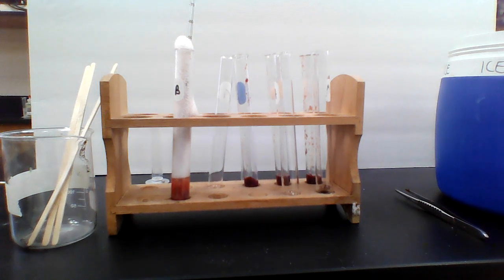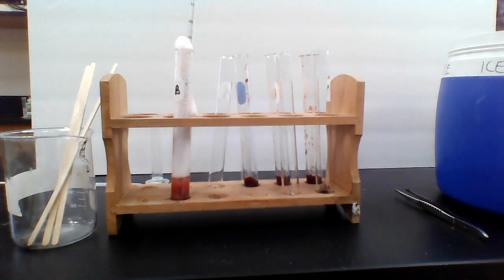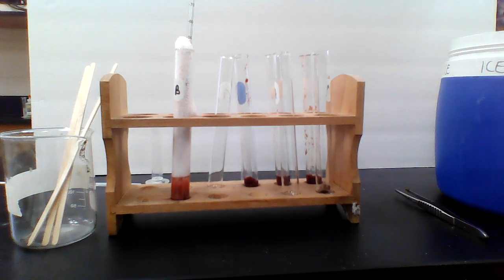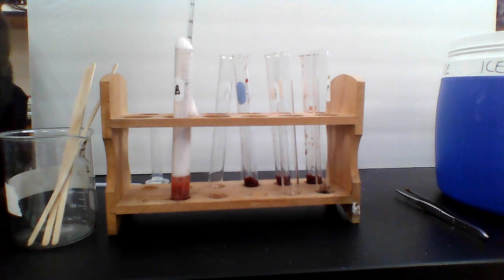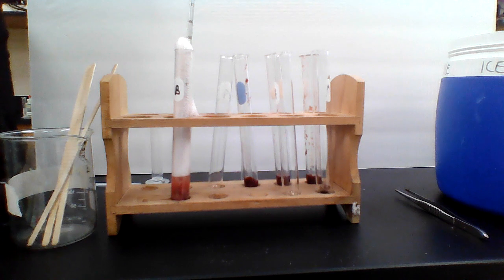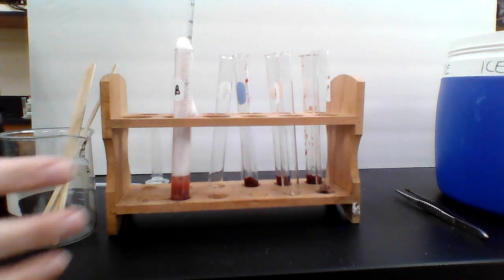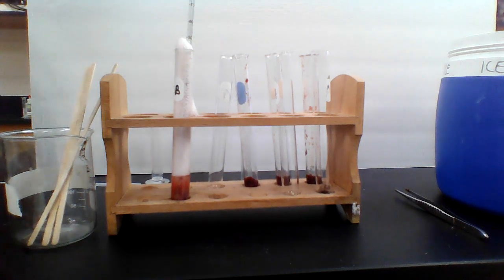The next one that I'm going to try to do, and it might not work very well, is the frozen liver. I don't have access to a freezer. So I have the frozen liver sitting in some ice right now, but it looks like it didn't really freeze. It looks like it's mostly room temperature. So I don't know that this one's going to work the way I want it to. So maybe we'll skip the frozen liver. I'm not really going to skip it. I want you to write it down in your data table, but we just won't do it because it doesn't look frozen. So for the frozen liver, actually before we do it, let's take the temperature.